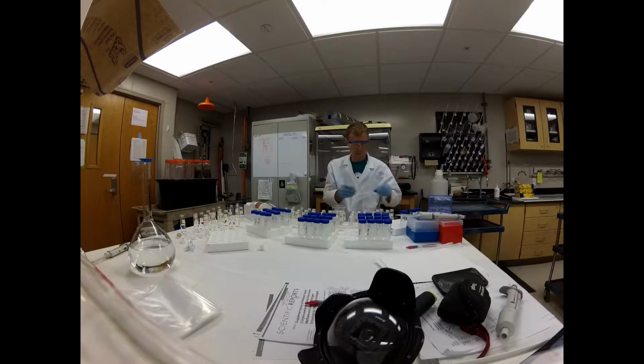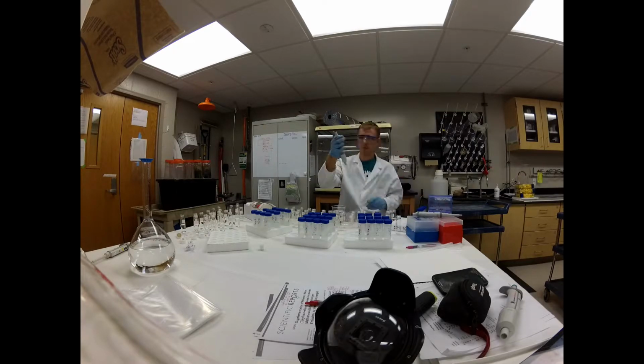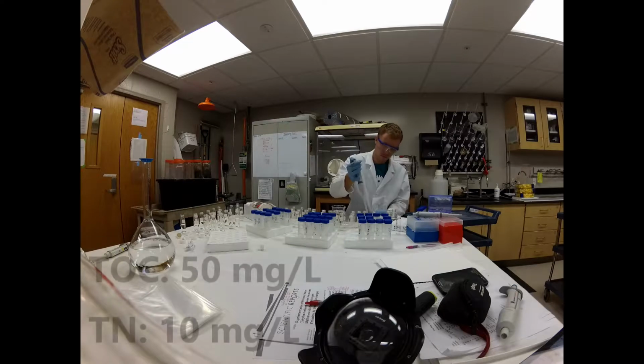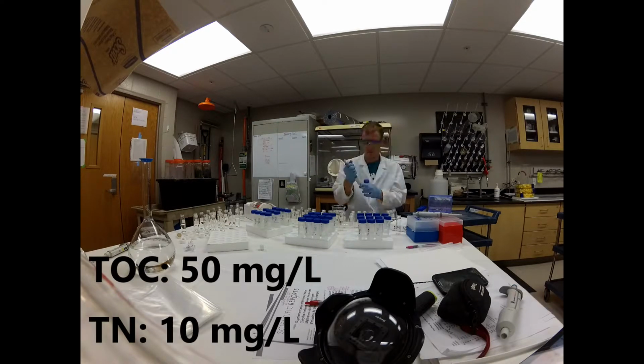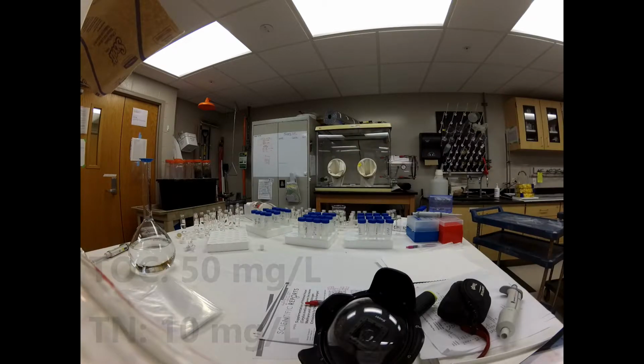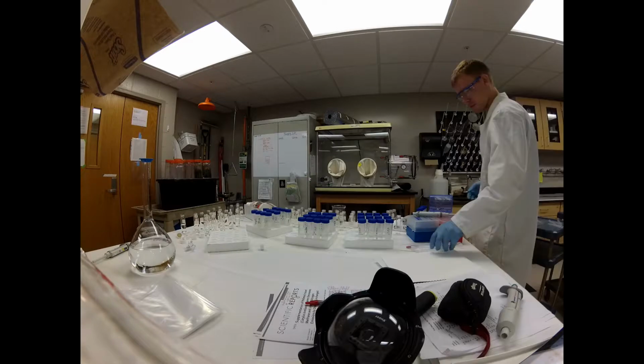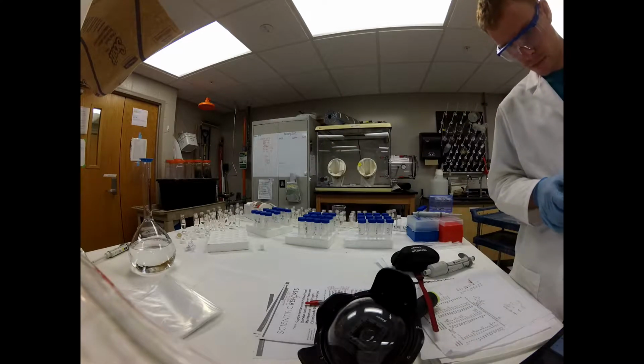To prepare samples for analysis, first consider the approximate nutrient or analyte concentration in your sample. The maximum concentration for the analyzer is 50 milligrams per liter of total organic carbon and 10 milligrams per liter for total nitrogen. If you are sampling from highly organic soils or eutrophic systems, for example, highly polluted lake water, you may need to conduct a 10 or 20 times dilution to ensure the samples fall below the limits of the machine. Failure to do so results in complications to the whole analysis and may delay other scientists attempting to use this instrument.